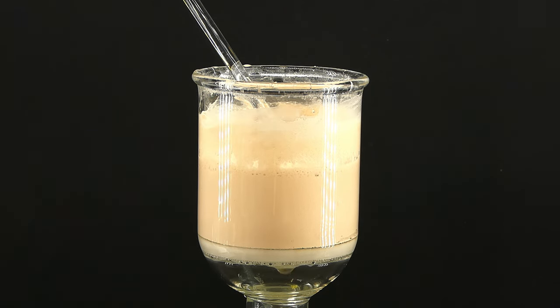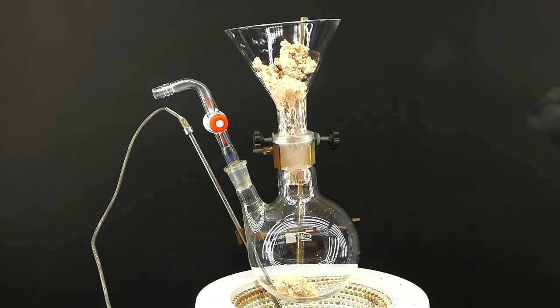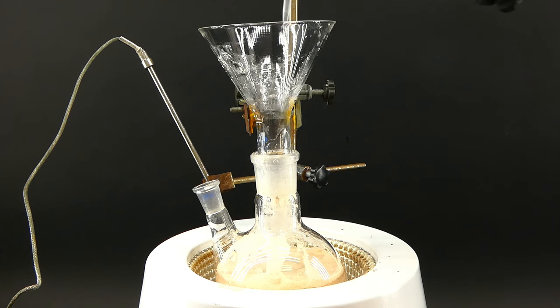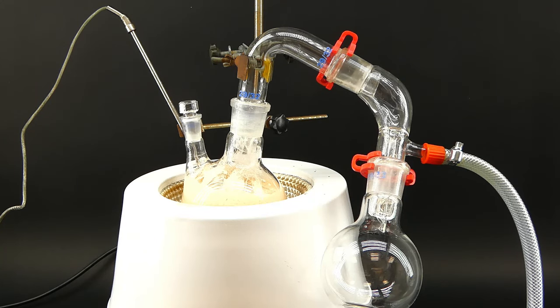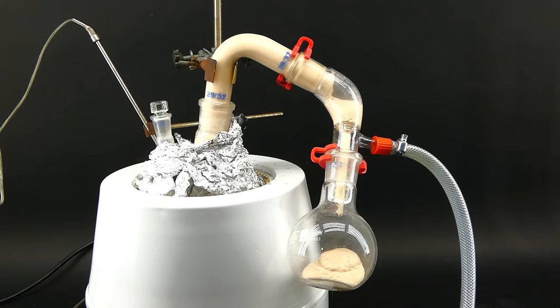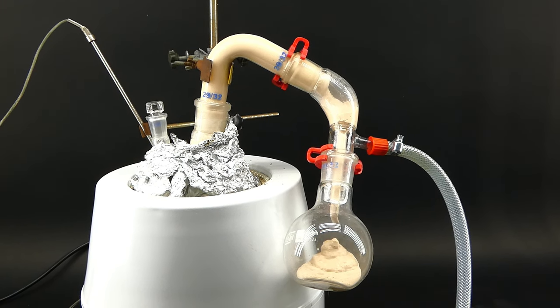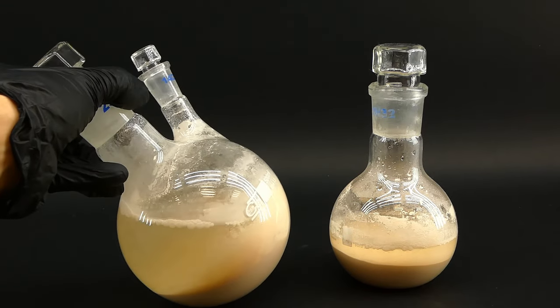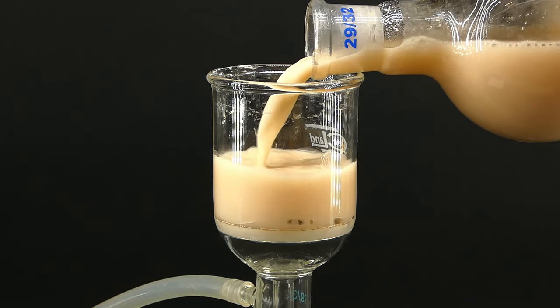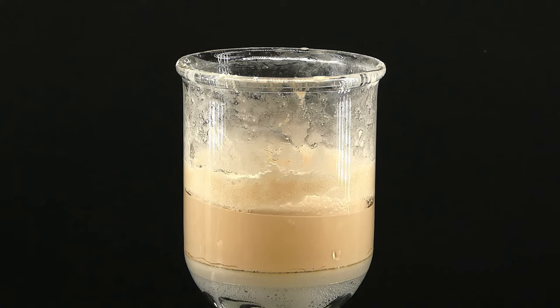To dry the diketone, I first had to transfer it into a flask, which turned out to be easier said than done. Even though I thoroughly dried it on the vacuum, it was still a thick paste, and I had to use a lot of water to get it in there. This meant I now had to remove even more water, so I decided to set up a DIY short-path vacuum distillation apparatus — but that didn't quite go as planned. Almost all of the diketone came over with the water, which was very bad. I was really worried, so I quickly saved as much of the diketone as I could by washing everything down with more water. I then vacuum filtered everything and got the whole filter into the oven at 70 degrees Celsius for a few hours to initially dry the diketone.